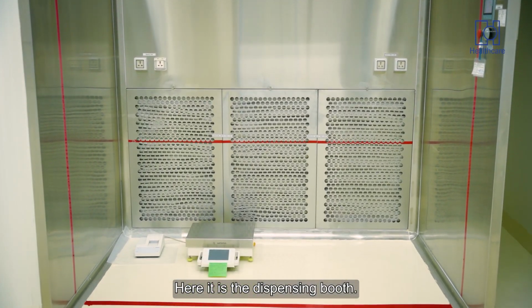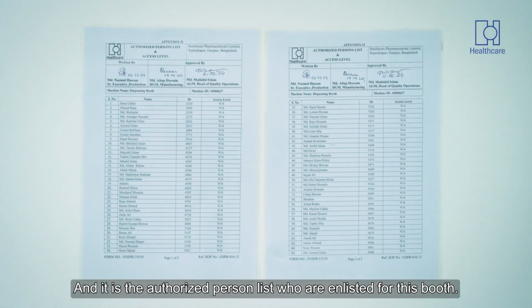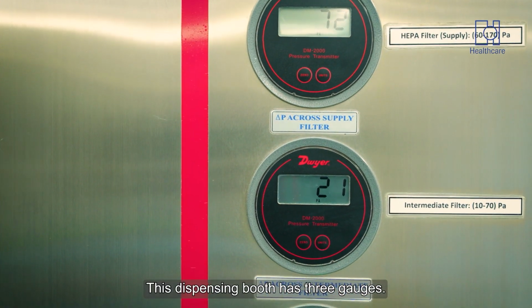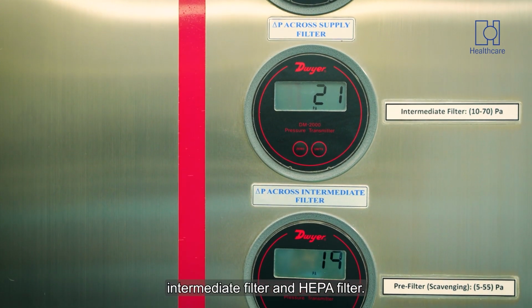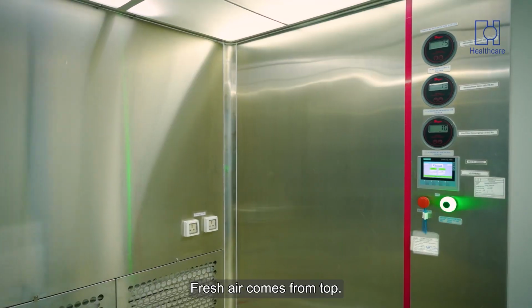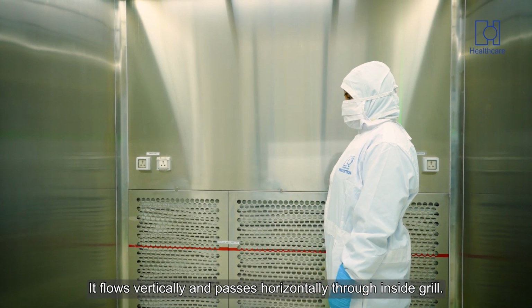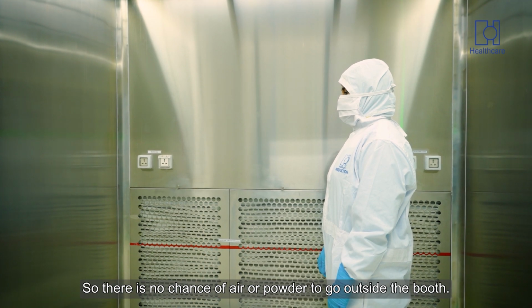Here is the dispensing booth, and this is the authorized personnel list of those enlisted for this booth. It is operated by HMI. This dispensing booth has 3 gauges. Those gauges are for pre-filter, intermediate filter and HEPA filter. All the filters have calibration tags. Fresh air comes from the top. It flows vertically and passes horizontally through the inside grill. So, there is no chance of air or powder going outside the booth.